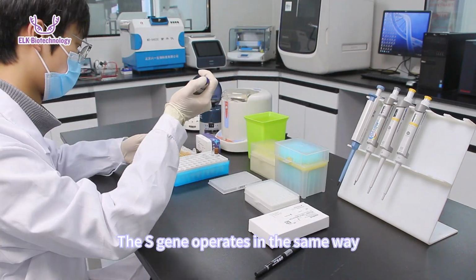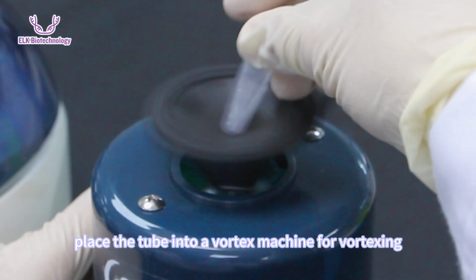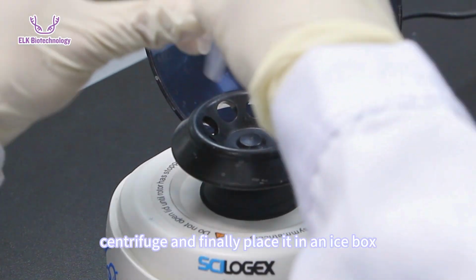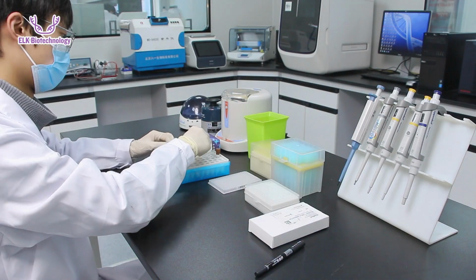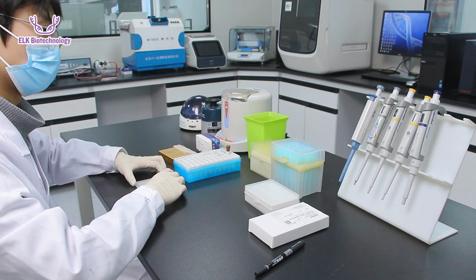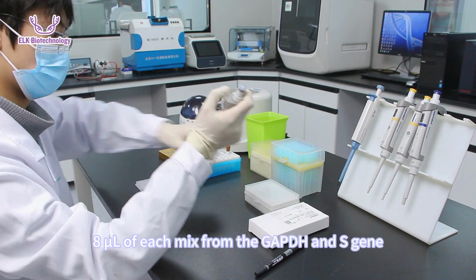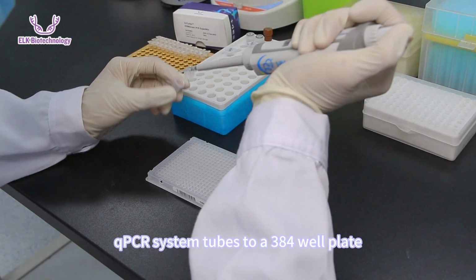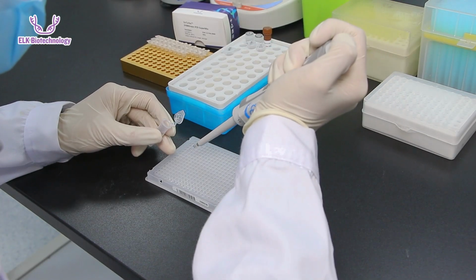The S gene operates in the same way. After adding liquid, place the tube into a vortex machine for vortexing, centrifuge, and finally place it in an icebox. Use a pipette to transfer 8 microliter of each mix from the GAPDH and S gene qPCR system tubes to a 384 well plate, with 4 replicates for each sample.